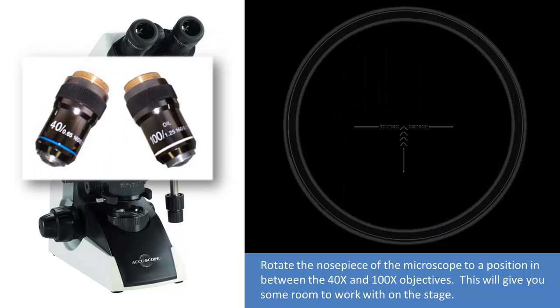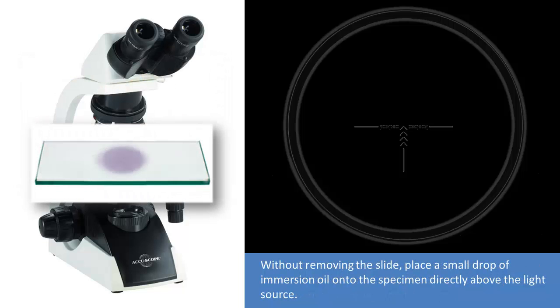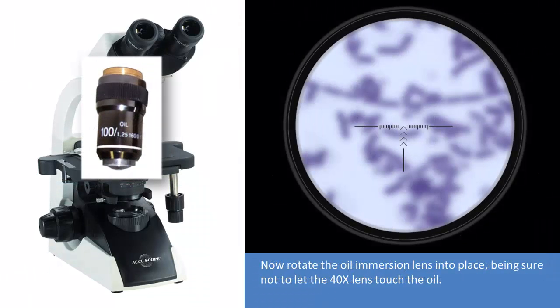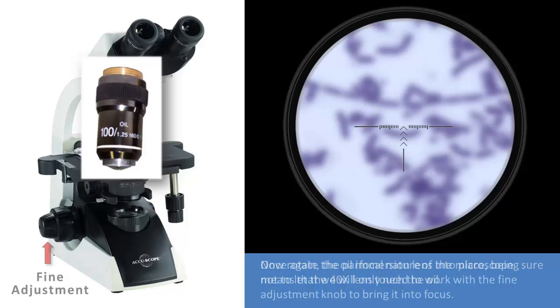Rotate the nose piece of the microscope to a position in between the 40x and 100x objectives. This will give you some room to work with on the stage. Without removing the slide, place a small drop of immersion oil onto the specimen directly above the light source. Now, rotate the oil immersion lens into place, being sure to not let the 40x lens touch the oil.